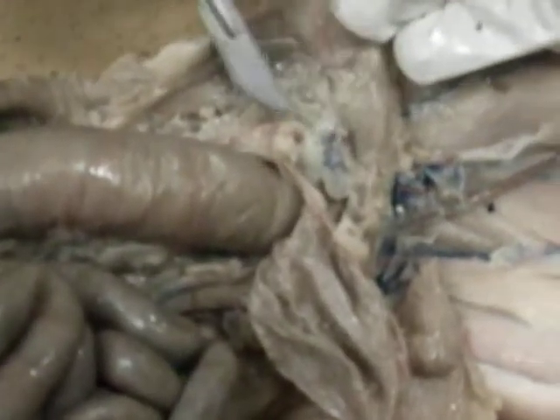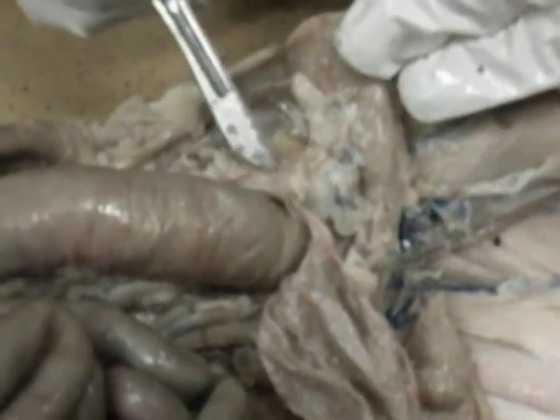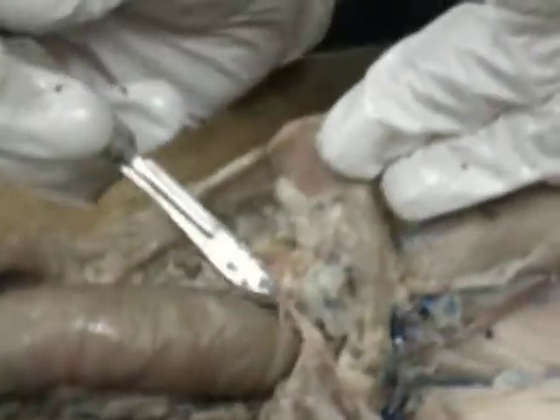So then when you get to the inside, it splits into 2 major parts. One of them is your testicular artery, which is this one. You have to know that for the artery section, so don't cut that. And then the other one is the loopy part here, and that's the vas deferens. This loop comes up and over the ureter on both sides. So there's one loop, there's the other loop. That's the vas deferens. And that will join up again down here with the urethra and then exit. So it actually goes down and joins right at the base of the urinary bladder and the urethra. So vas deferens, spermatic cord.